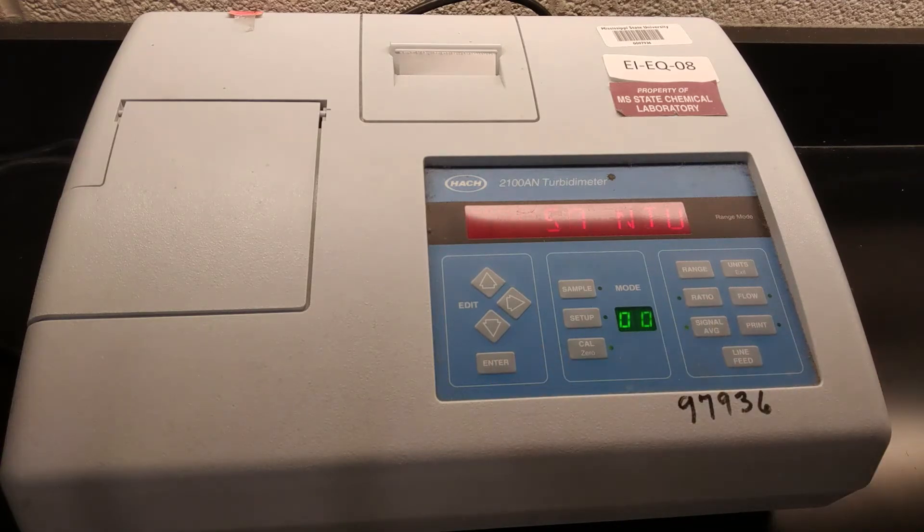Each calibration takes one minute. So you can see the countdown timer on the little display. We'll probably speed this up in post-production. Okay, so it finished calibrating that first standard.